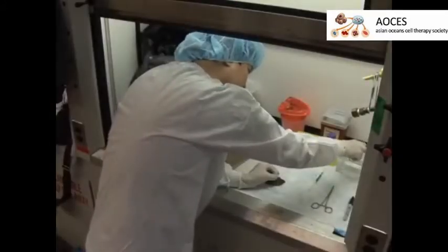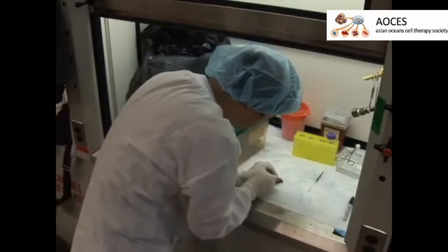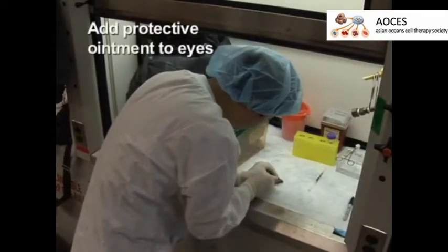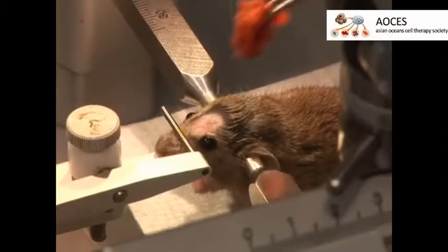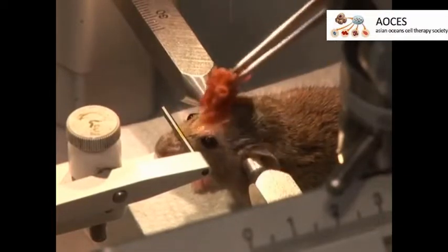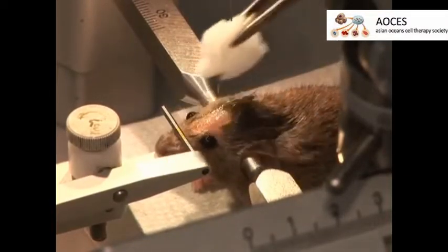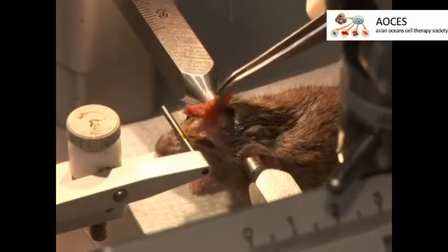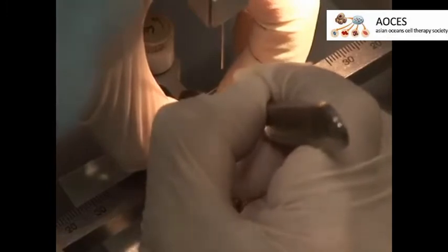After deeply anesthetizing the mouse with an approved anesthetic, shave the hair on the head around the area of the incision site. Carefully place the mouse into the stereotactic apparatus and ensure that the head is stable. Disinfect the scalp three times each with iodine and a 70% alcohol solution, alternating between each solution. Using a sterile scalpel, make a sagittal incision in the scalp to expose the skull.